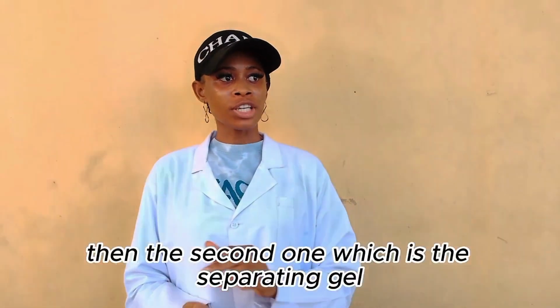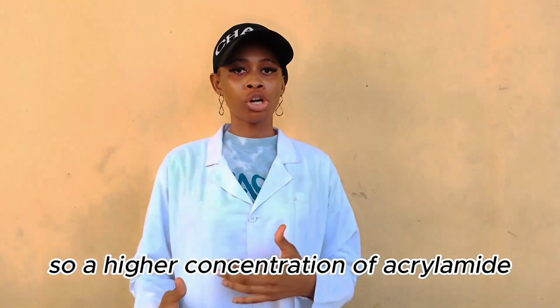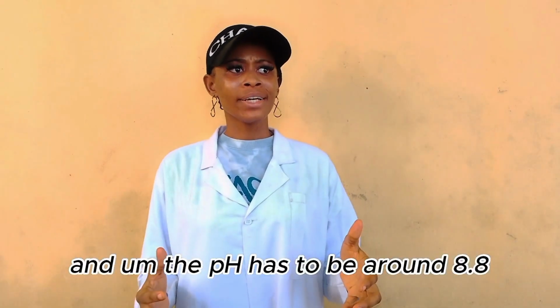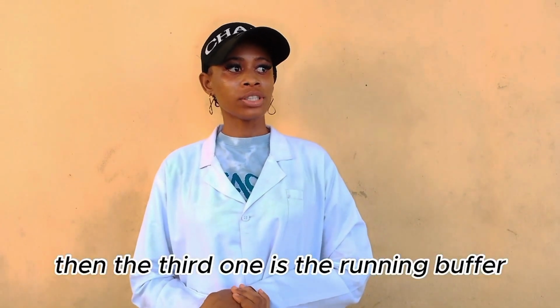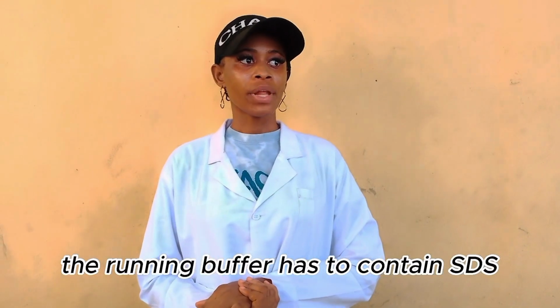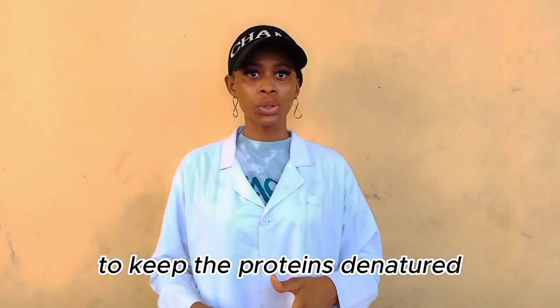Then the second one, which is the separating gel, the pores have to be very tight because it has to do with separating the proteins. So a higher concentration of acrylamide is used in making this gel. And the pH has to be around 8.8. Then the third one is the running buffer. The running buffer has to contain SDS to keep the proteins denatured.